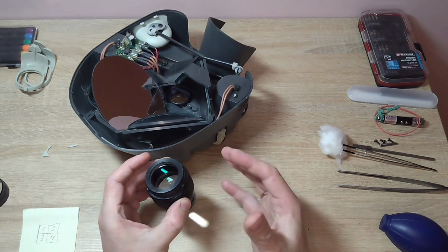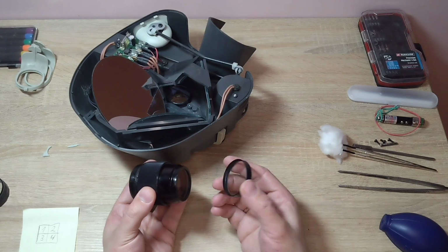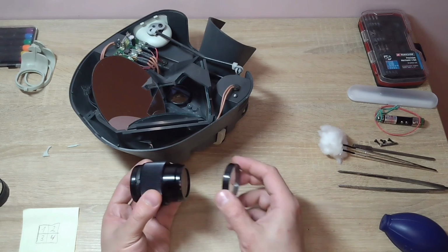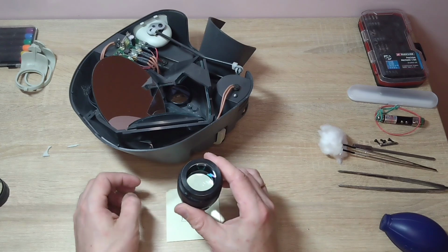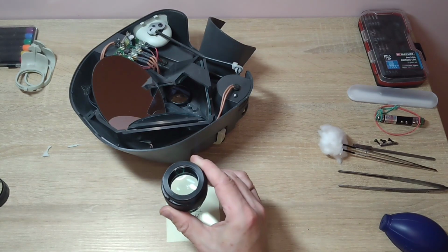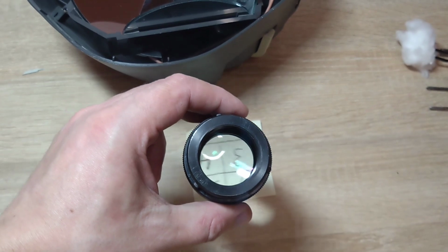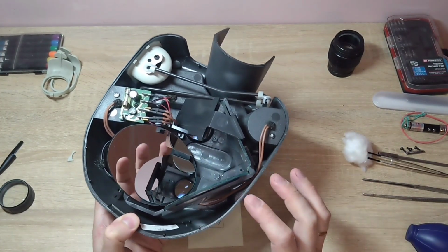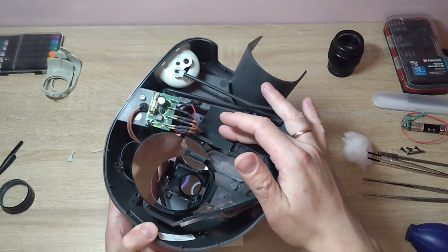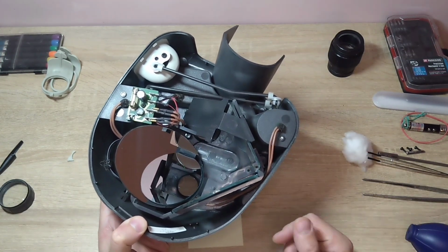You can look through the microscope with or without this cap. It is simply for protection. This objective, when you essentially look at an image, inverts the image. After this, the image passes to a group of mirrors. There are 4 here, and these mirrors also invert the image.